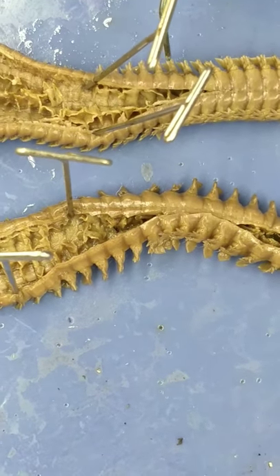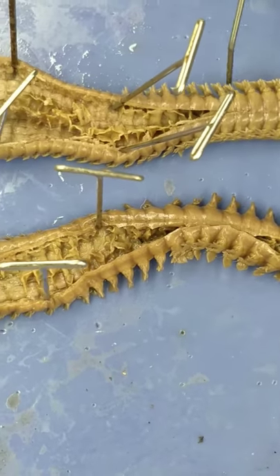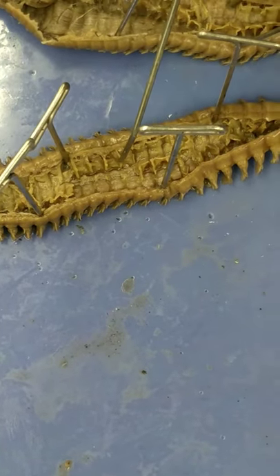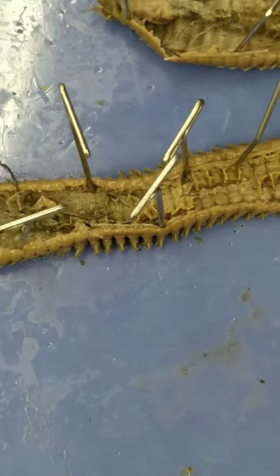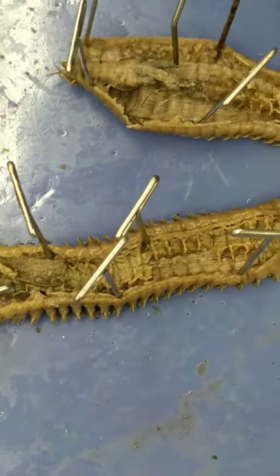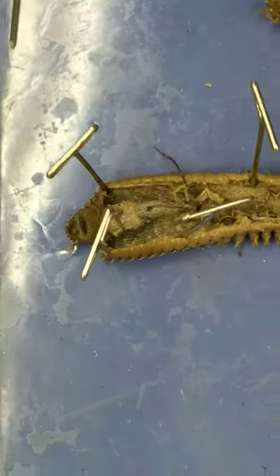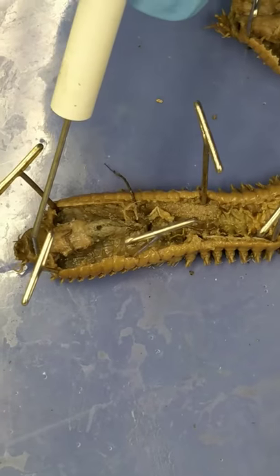And then the septae are off it, and then the separated segments here are septa, and this is the cecum, and then you have an inverted pharynx here.